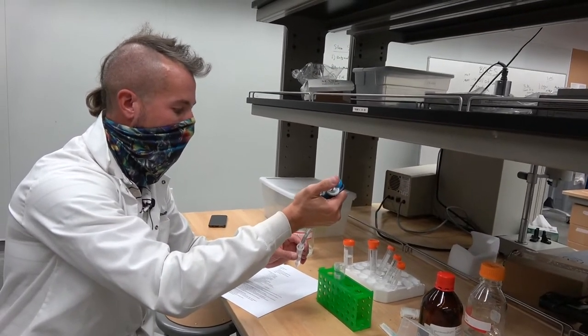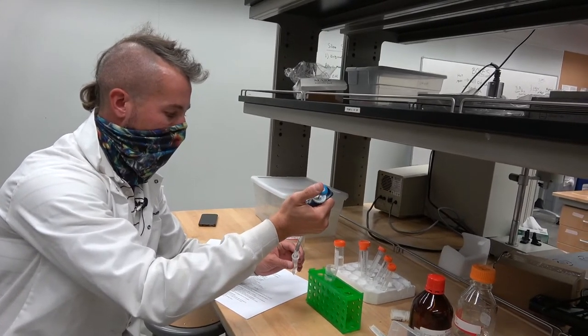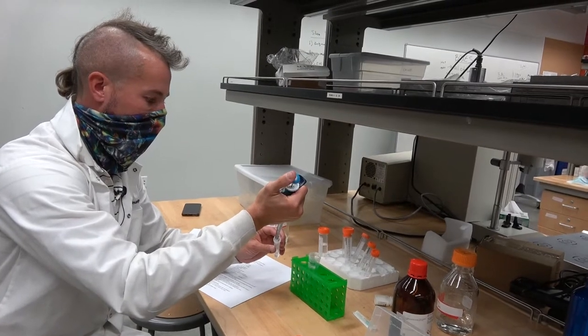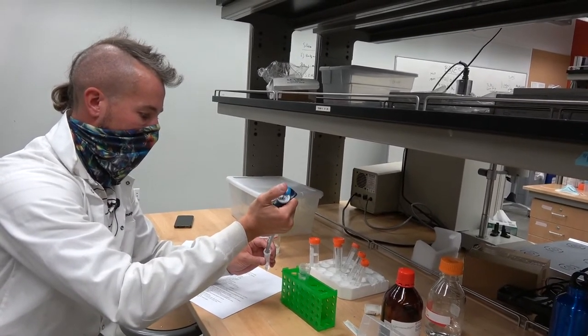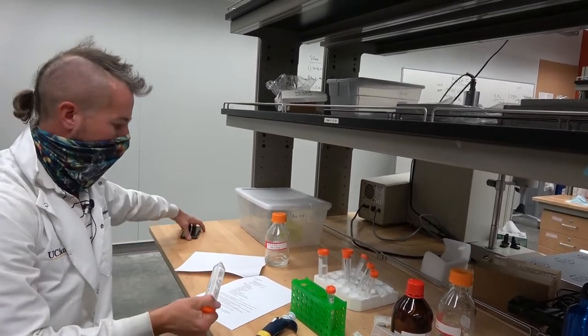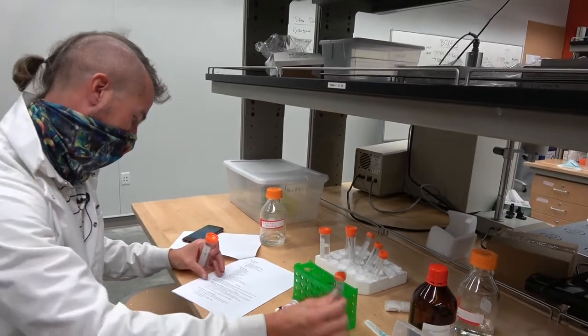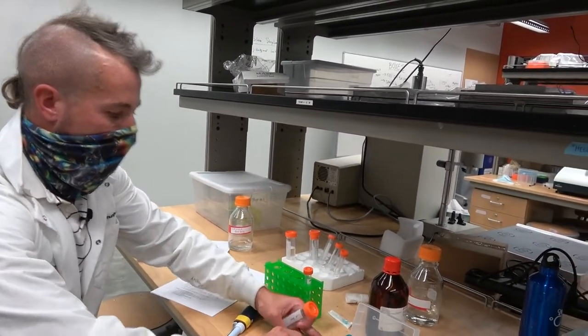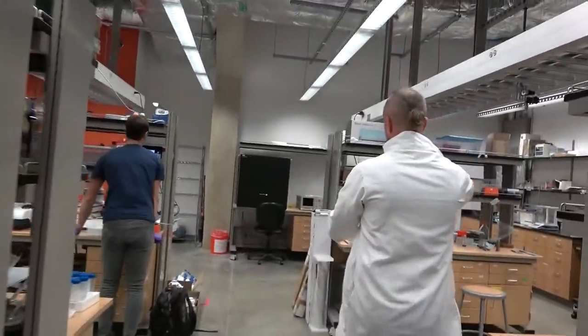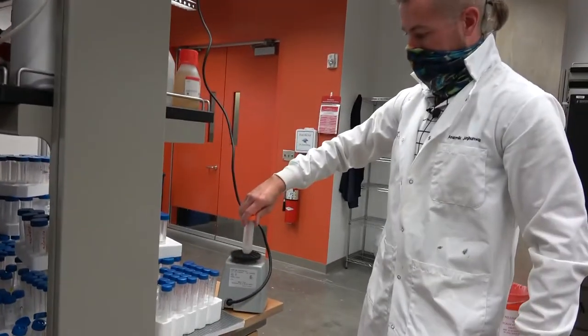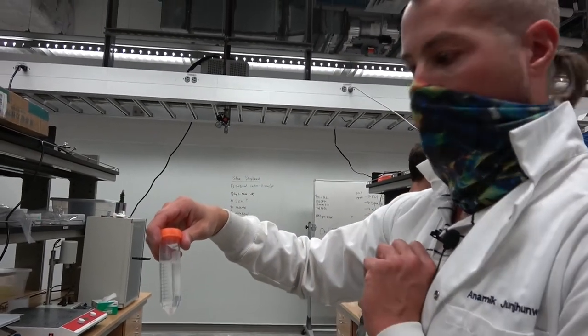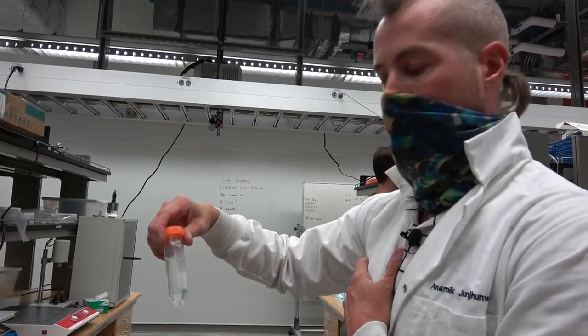One, two, three, four, five, six. Of course I could have used a graduated cylinder but I've already set up shop. Let's carefully record the start time and I'm going to vortex it, but I want you to appreciate this color. It's pretty transparent, and we're going to come back and take a sample of this, put it into the spectrophotometer, and monitor that color change over time.